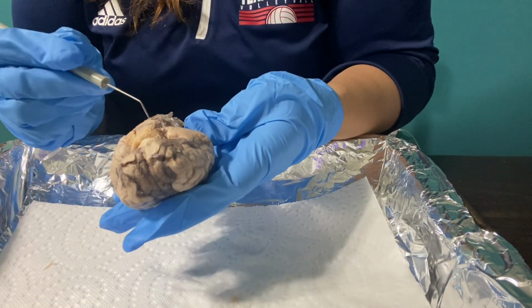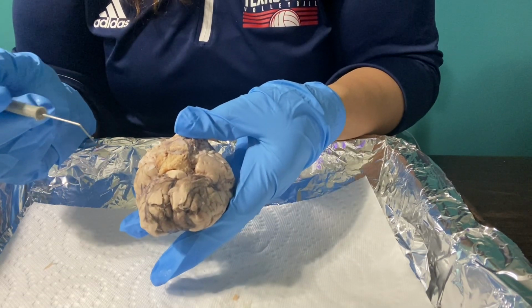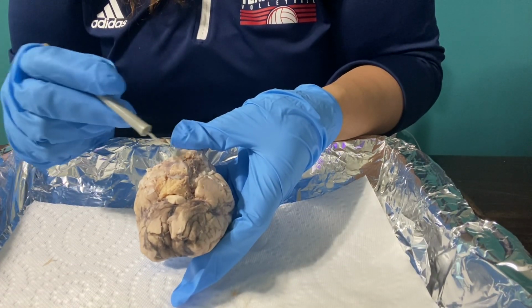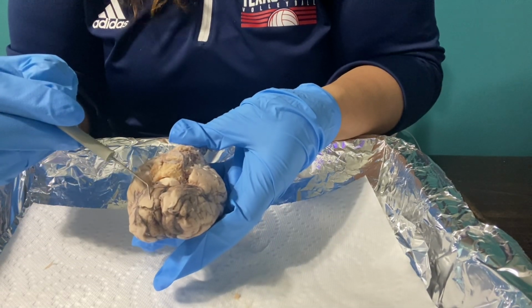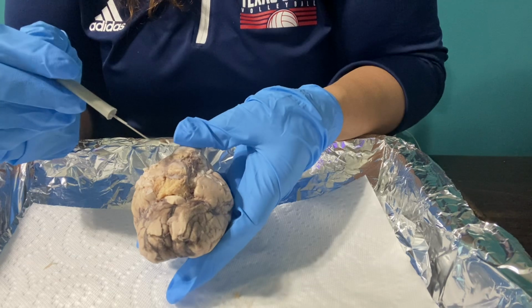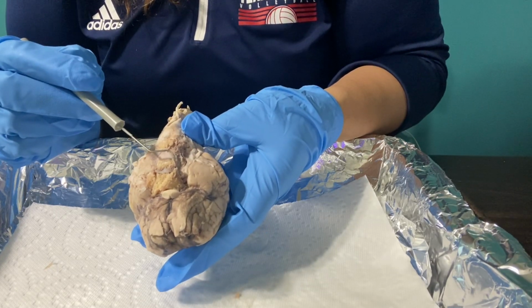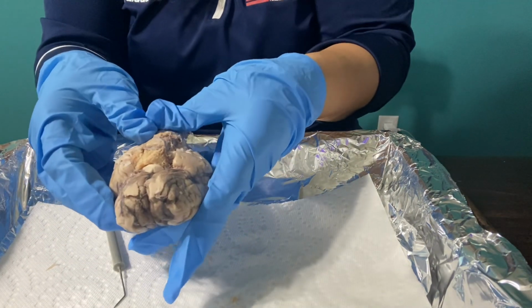Okay, but also I wanted to talk about the occipital chiasma, which is right around here. It's kind of hard to lift, but I can talk about that. The correct term could also be the optic chiasma, but this is pretty much where the visual pathway occurs for those nerve fibers from the eyes to cross over, and that is why I then went into talking about the olfactory bulbs as well, as they're connected. But anyhow, back to the occipital chiasma. This is pretty much the visual pathway where some of the nerve fibers from those two eyes cross over. They're providing visual information, contributing to binocular vision and depth perception.